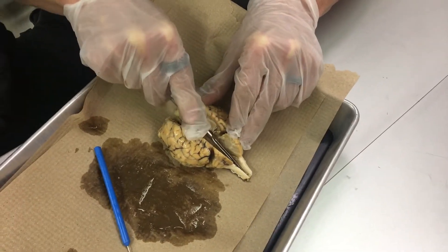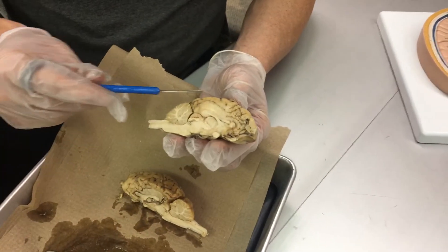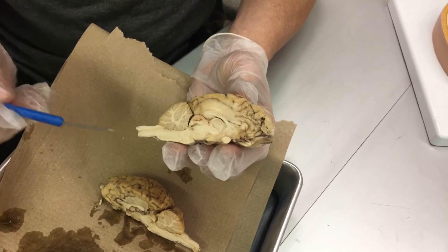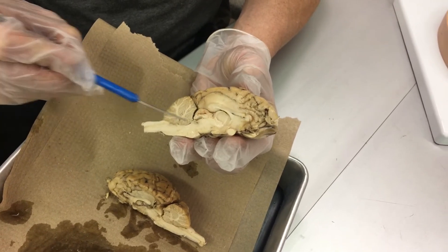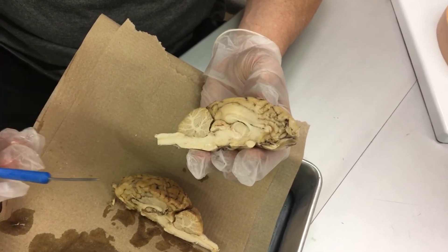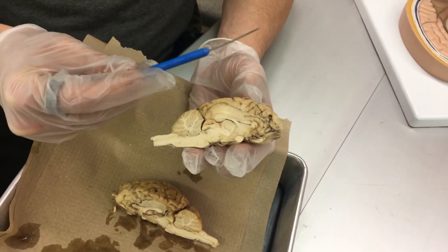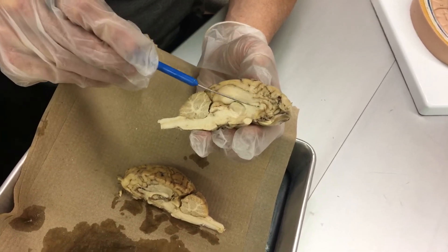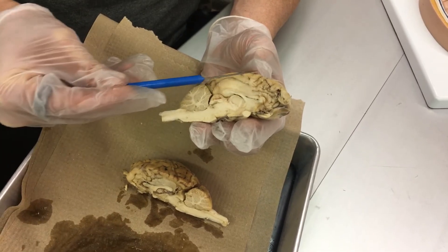We'll have two separate hemispheres to look at here. One thing I want to note is that both in the cerebrum and the cerebellum, the outer portion is gray — that's what we call gray matter. And you can see white matter here and all the way down through the brain stem into the spinal cord. The gray matter is the actual neuron cell bodies, and all the white areas are the axons taking information to and from the body. Motor signals tell muscles to move and glands to secrete going down, and sensory signals come from the periphery and go up to the brain.